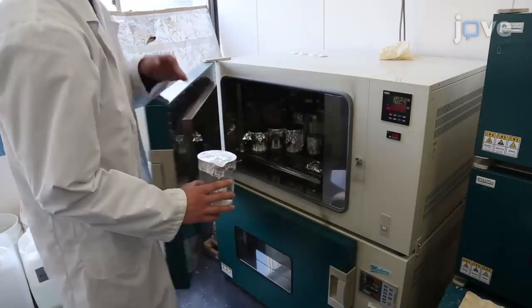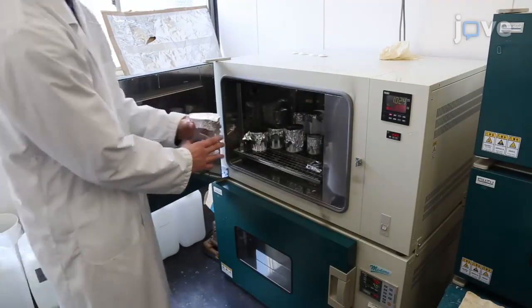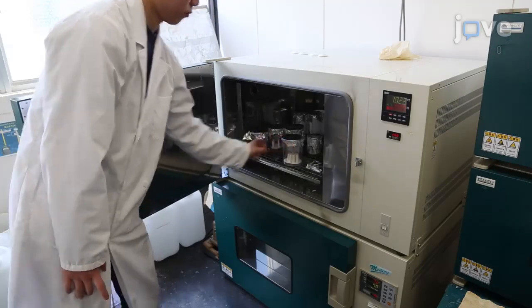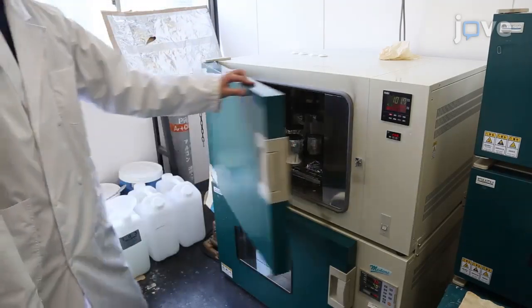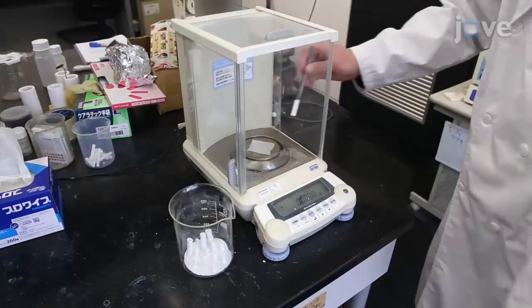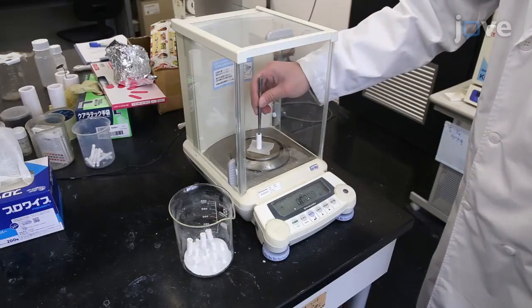Use a beaker to transfer the washed support into an incubator to dry at 110 degrees Celsius overnight. In the morning, measure the weight of the support piece.